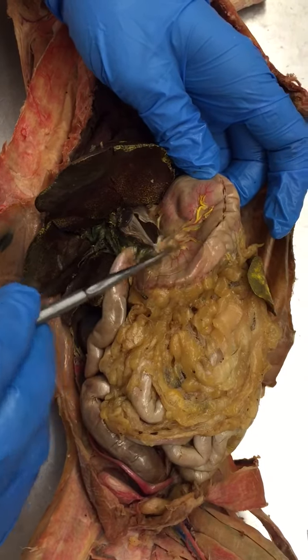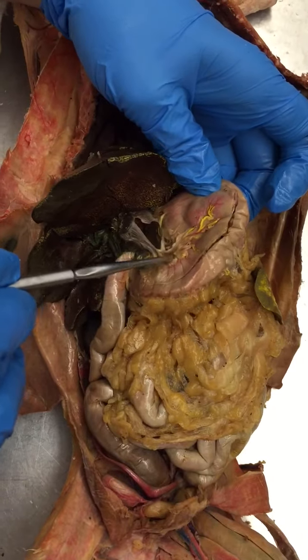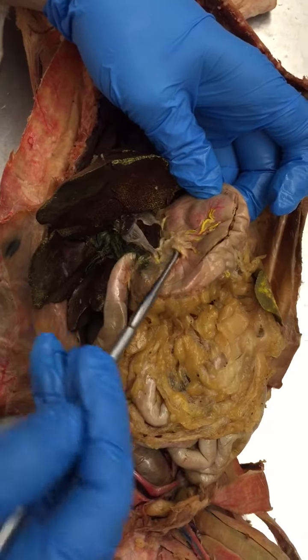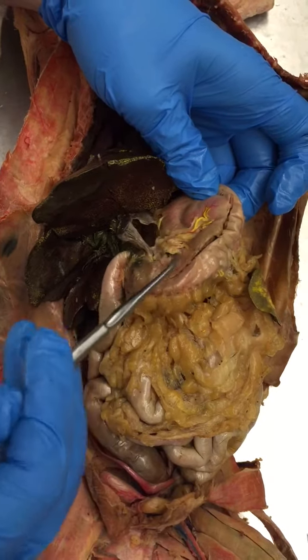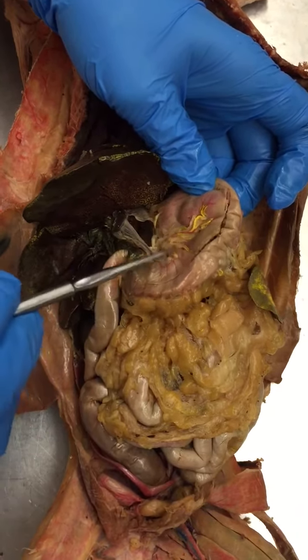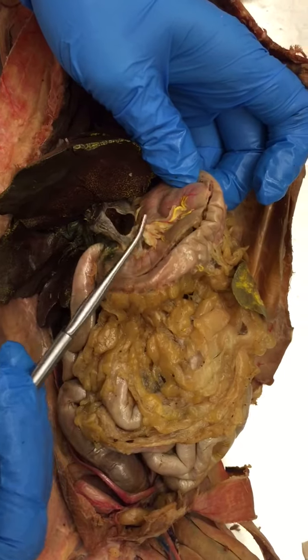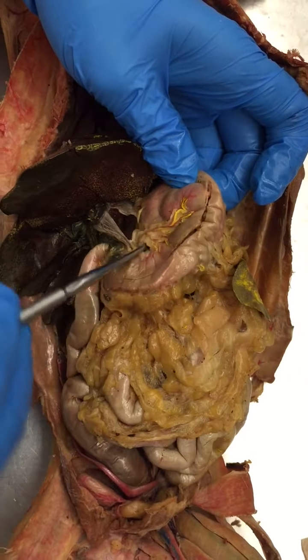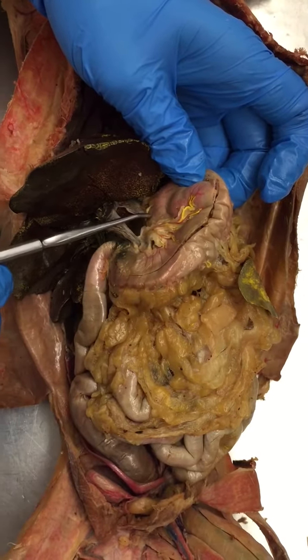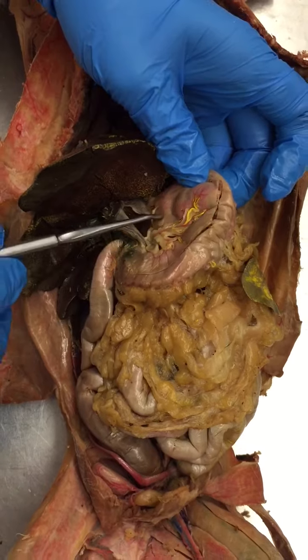On the lesser curvature of the stomach, which is right here, you have a little pad of adipose tissue and loose connective tissue — that's the lesser omentum. So the lesser omentum is on the lesser curvature.